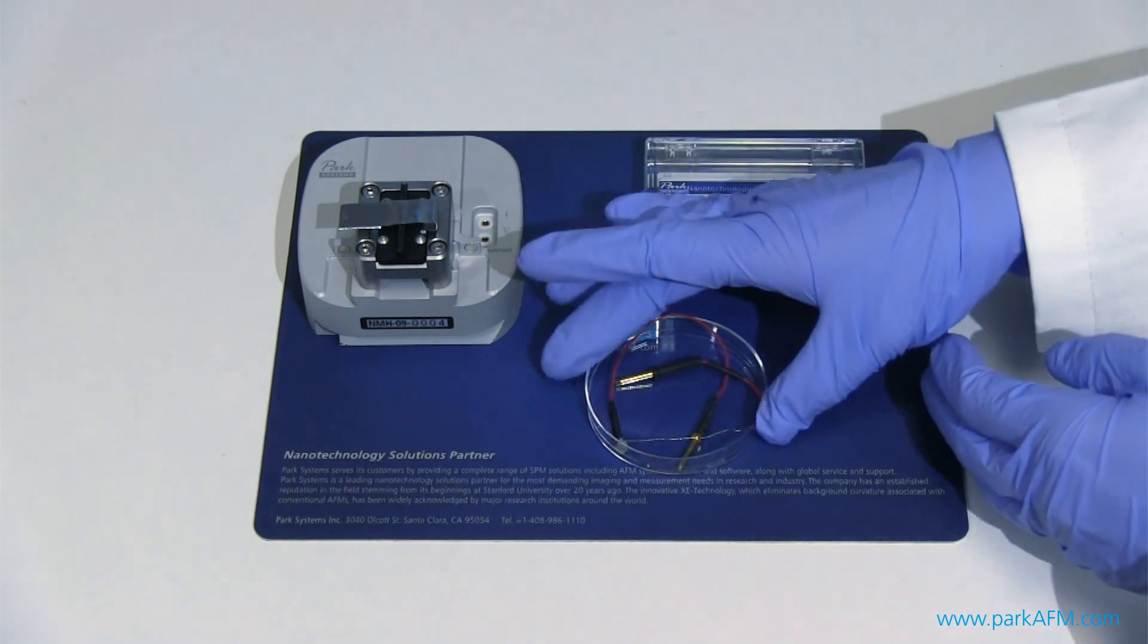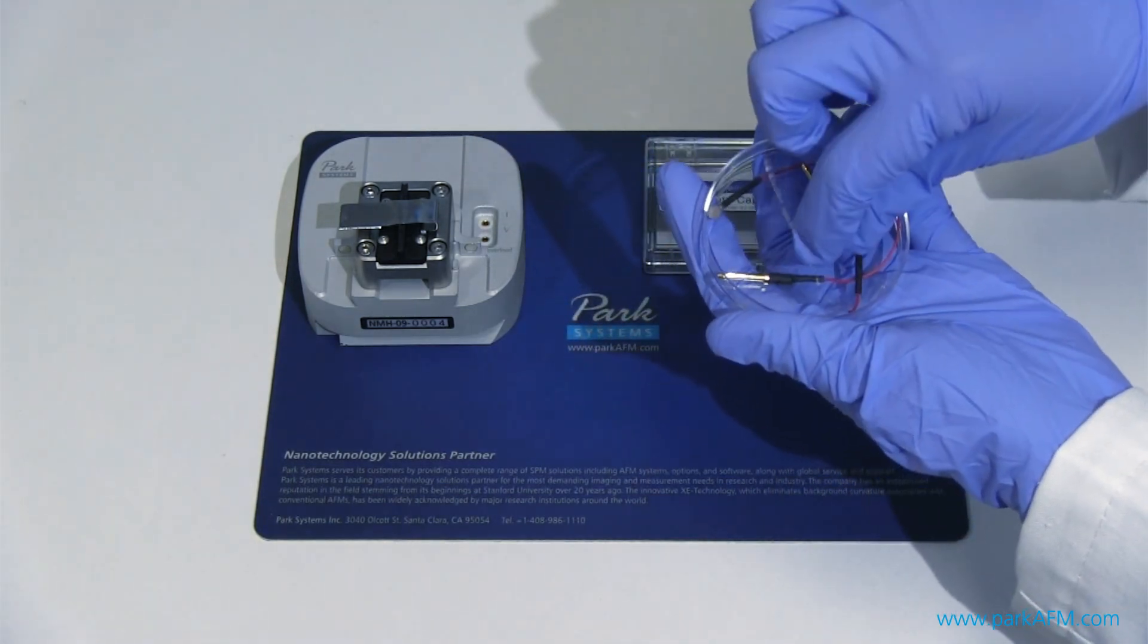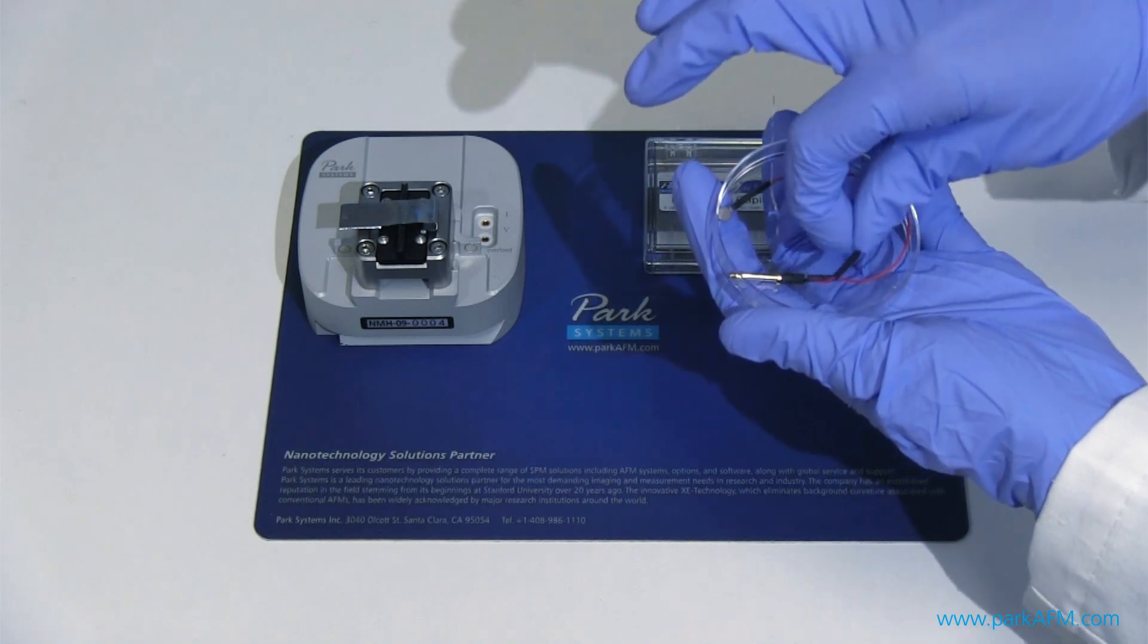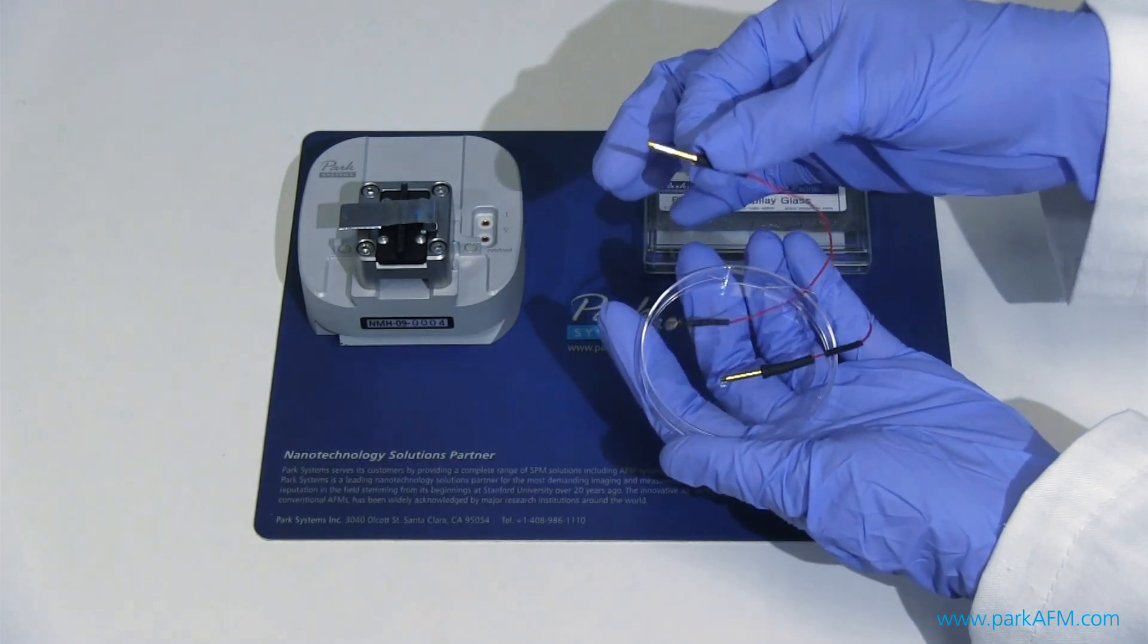Here we have the two electrodes. One is connected with the nano pipettes and the other one is the bath electrode we put into liquid.